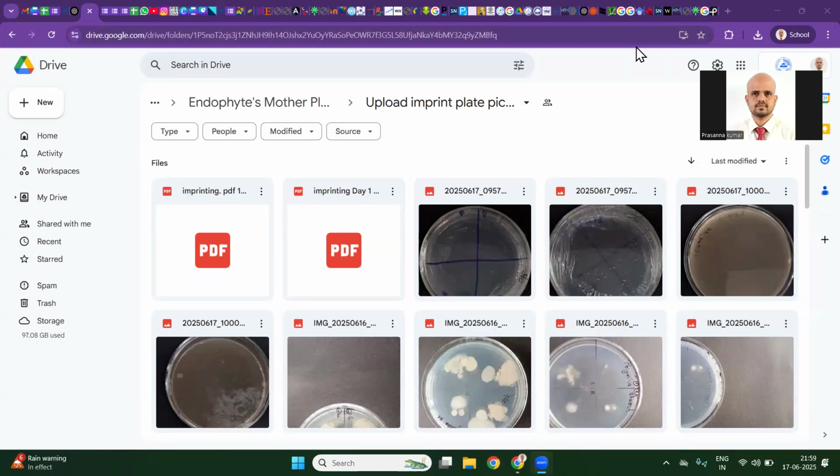Okay, hey, good evening. Today was really an interesting day. We have systematically examined more than 100 plates for endophyte growth.